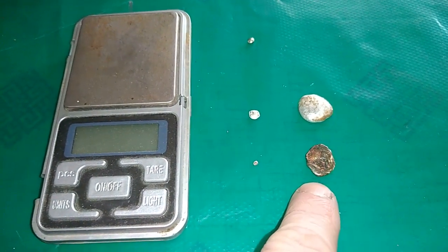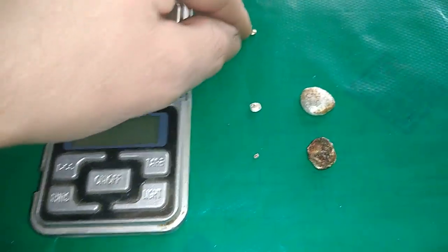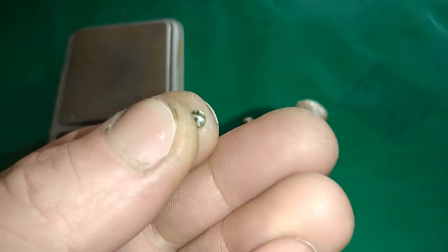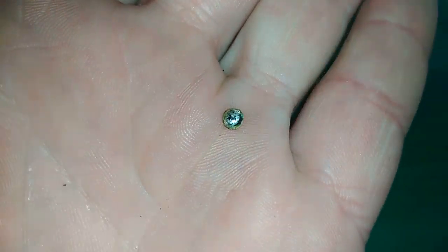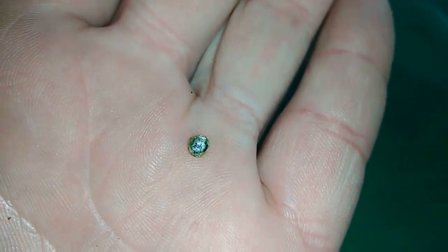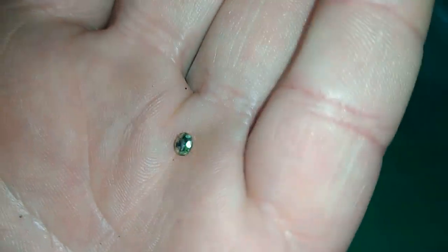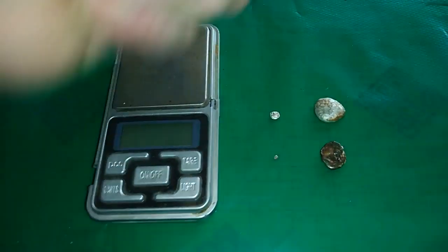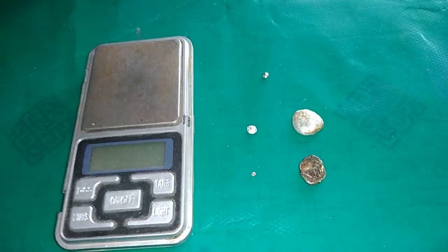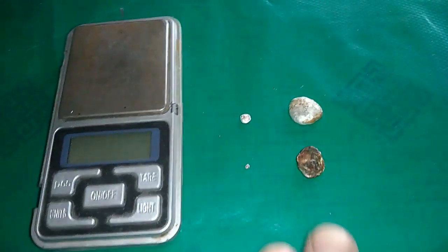Got some borax on it. But that bead I got from my drop with the DMG — the dimethylglyoxime. And this is from the previous tour of MLCCs, my old solution. I kept that solution for a long time. And I dropped that and melted it just to show you the second way how to drop palladium — with no chlorine, just drop with the dimethylglyoxime, DMG. So I will remove that to the side. This is important.